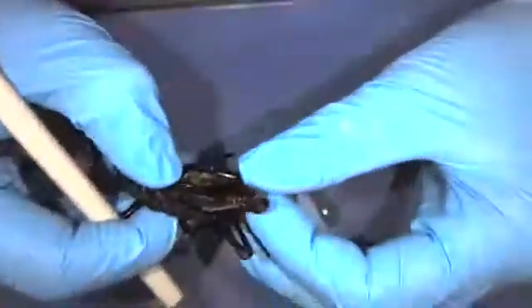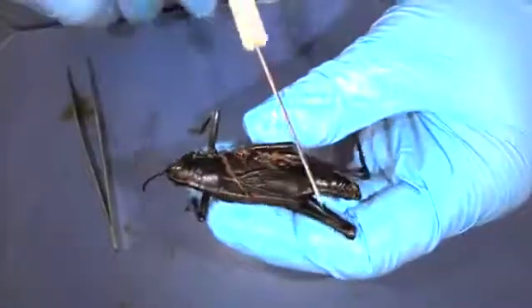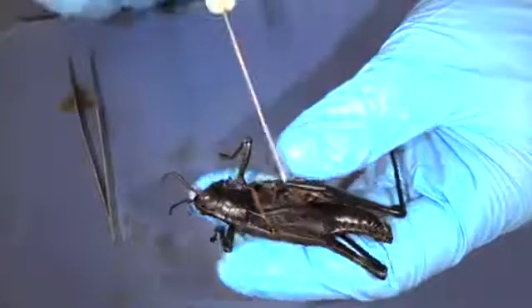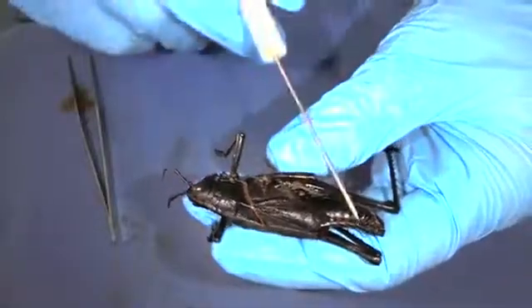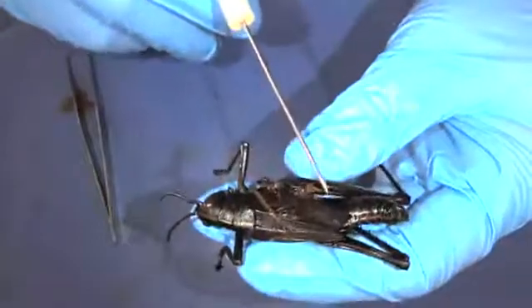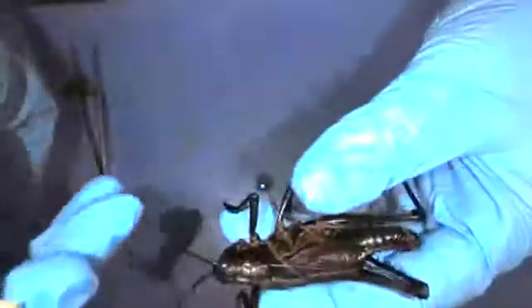Now, they don't really have a brain like we do. They have something called ganglia — and each segment of their body is controlled by its own ganglion. So they're pretty complex even though they're such a small, simple critter.